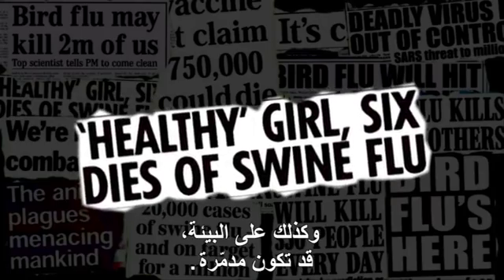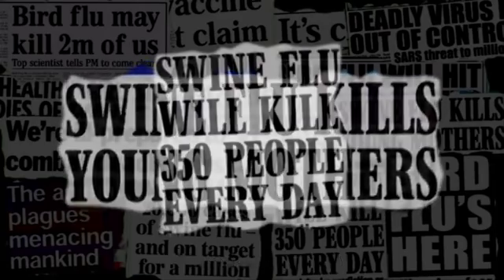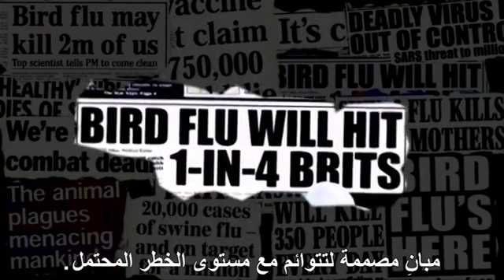The impact of some pathogenic organisms on human and animal health, as well as the environment, can be devastating. So it's essential that they can be contained in safe and secure facilities designed to cope with the potential level of threat.